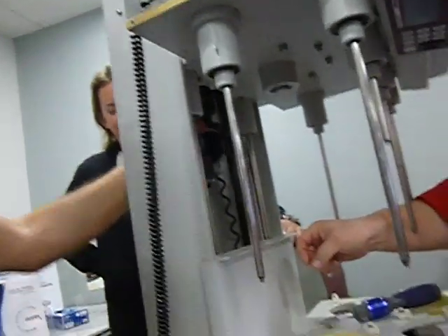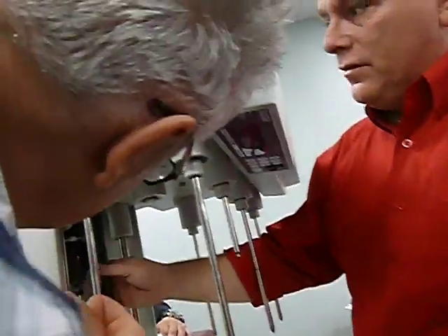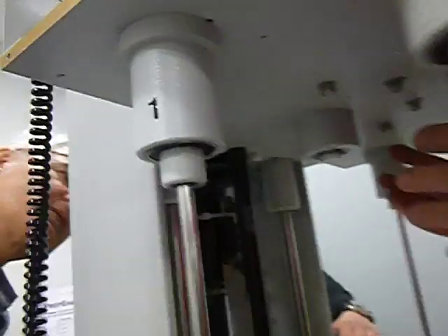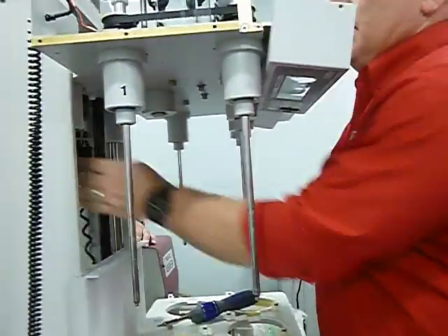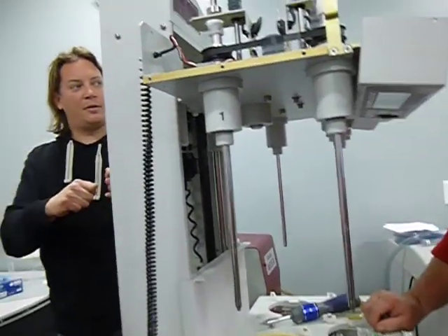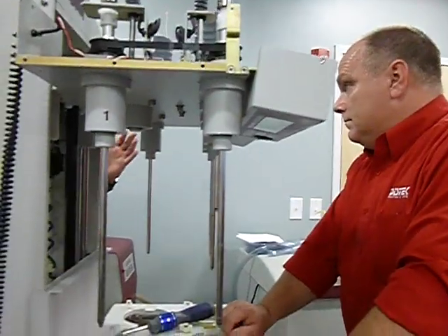Well, you got to compress it. I would take this whole motor off. The motor is also in the way. See how you can take it out. Which way? This way? I typically take this right here. I would loosen the motor off. Yeah. The motor's going to have to come up loosened, and then I would compress it down and take it out that way. Okay. So the new one is probably coupled a little tighter with wire. The new one is what? Usually if you get this, you get them compressed and it's wired together so that it's not in parallel position. It's all the way out. Yep, they're not wired together.